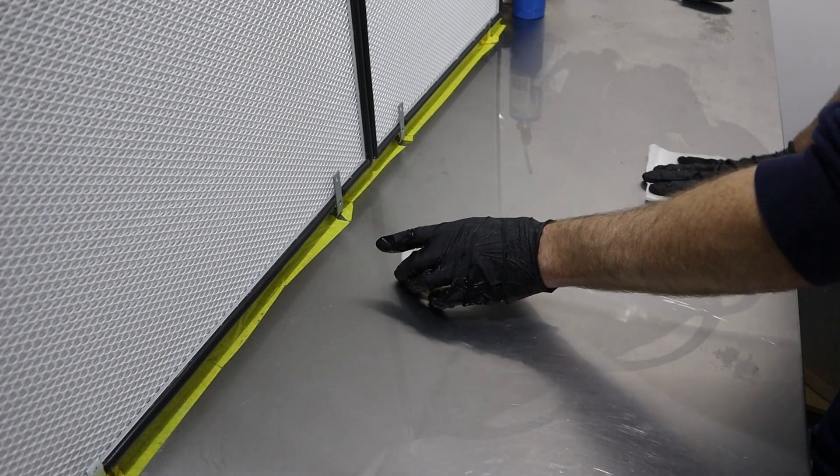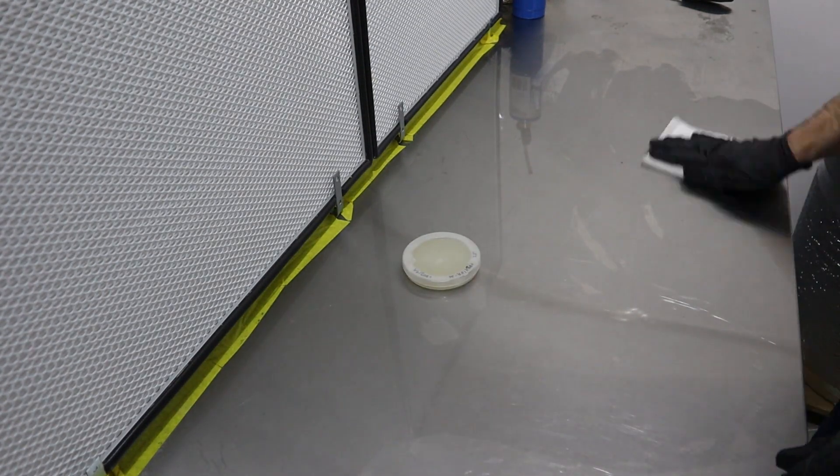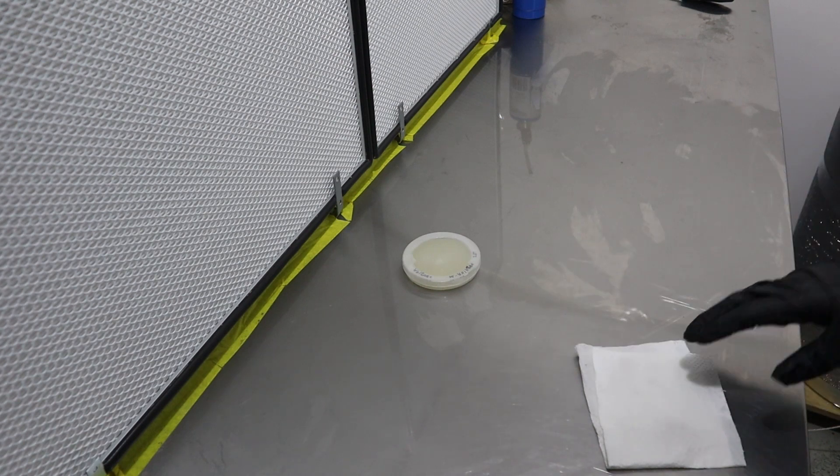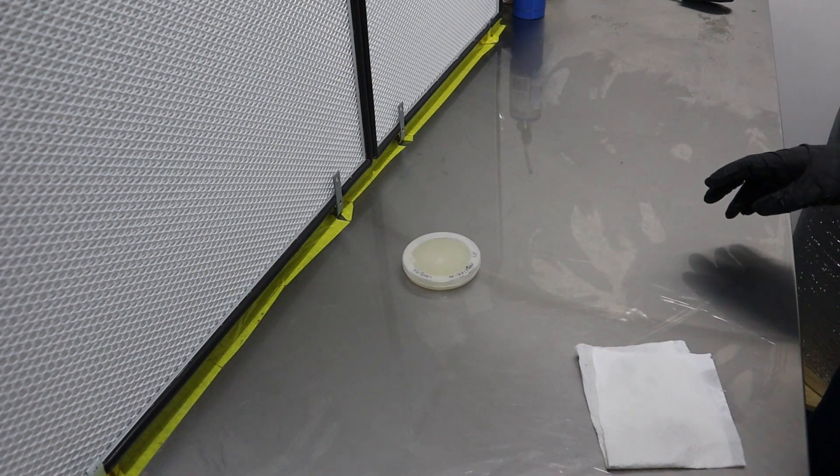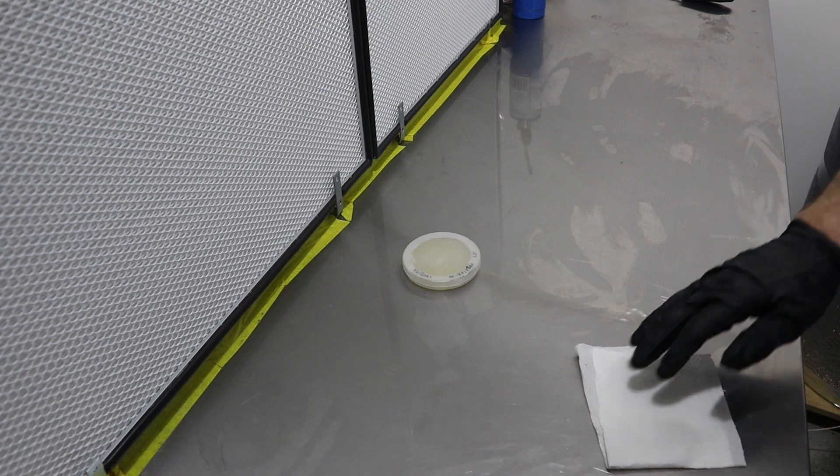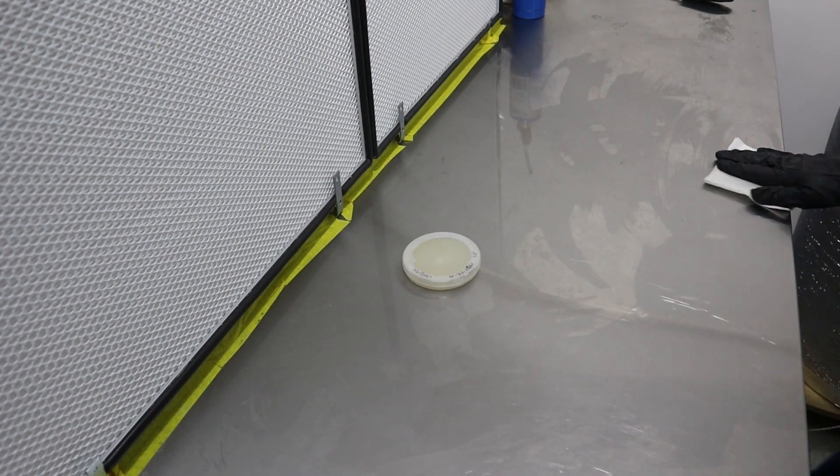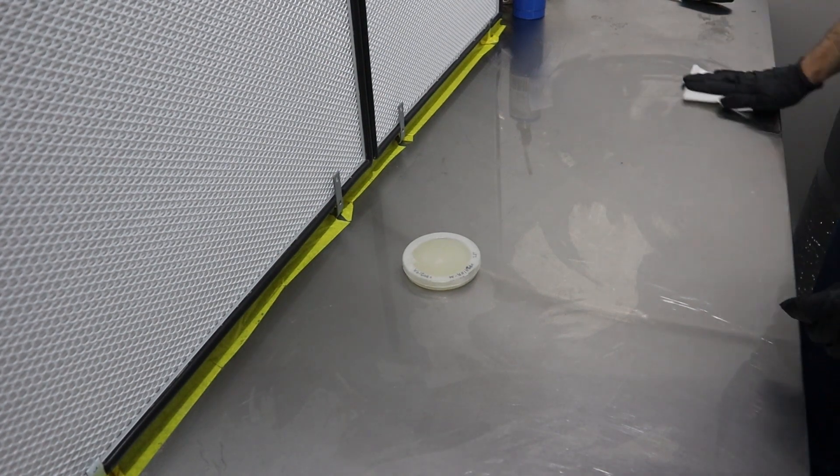We'll get my flow hood on now and then I'm going to give this a wipe down with the alcohol. I'll get the camera off because the flow hood makes a horrendous sound. I'm going to transfer this to another bunch of dishes and get them in my incubation room to grow out a bit.